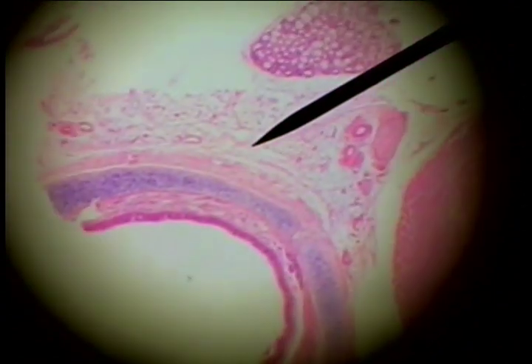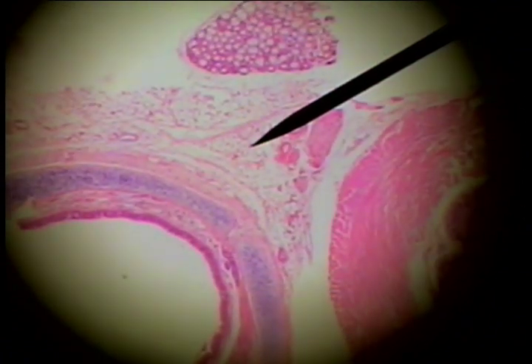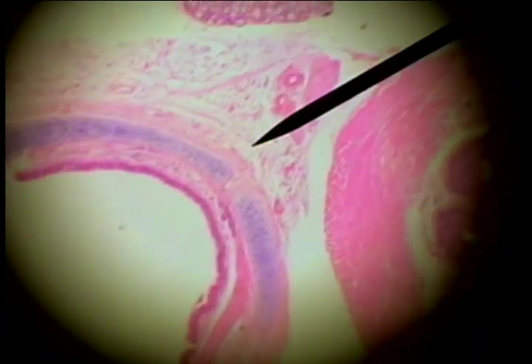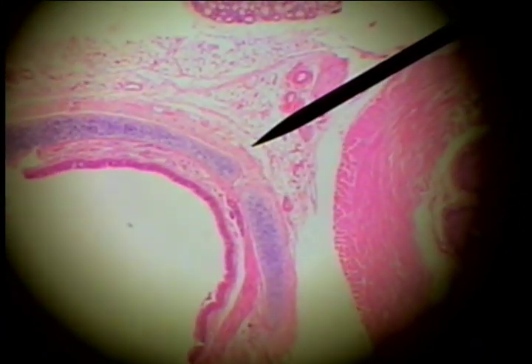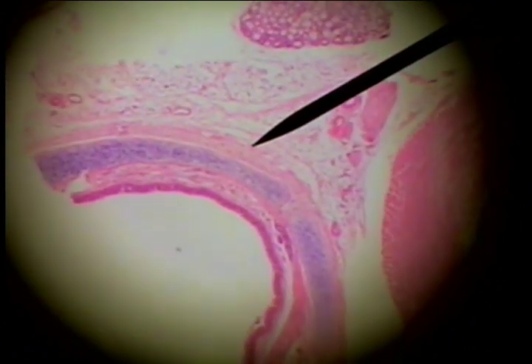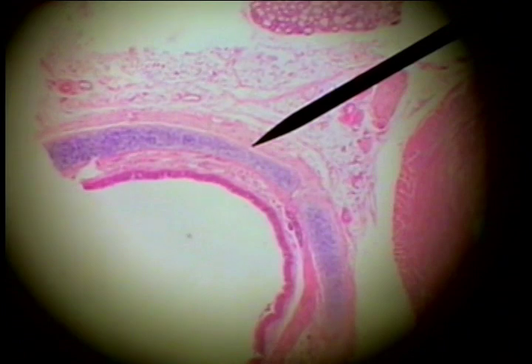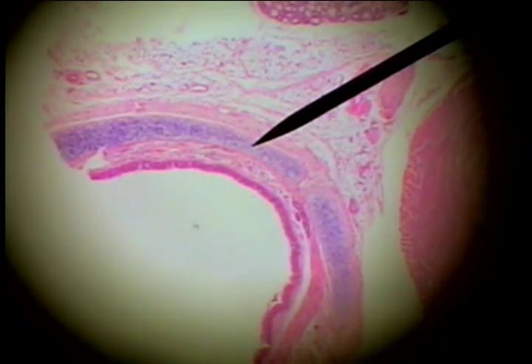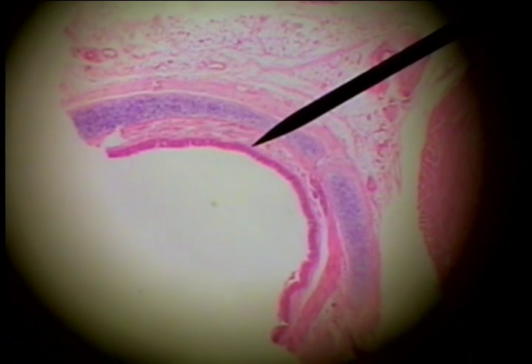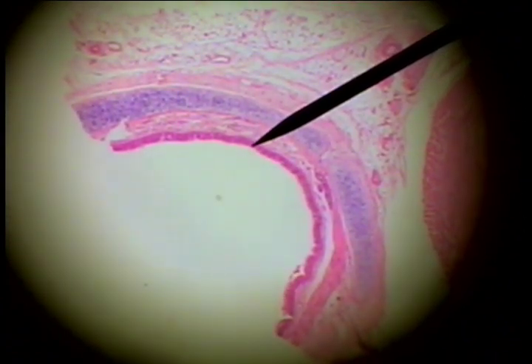If we look at the exterior, we see connective tissue out here with adipose, veins, arteries, and nerves. There is adipose here, and here is an outer layer of smooth muscle, a supportive layer of hyaline cartilage, a connective tissue layer, basement membrane, and the epithelium.